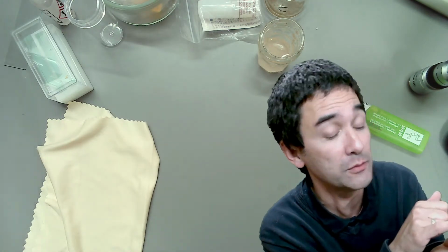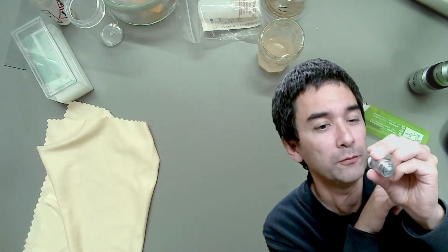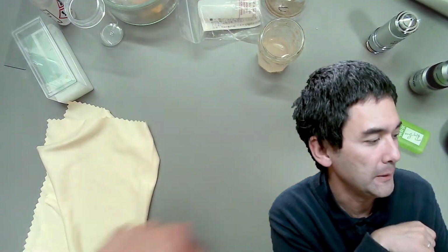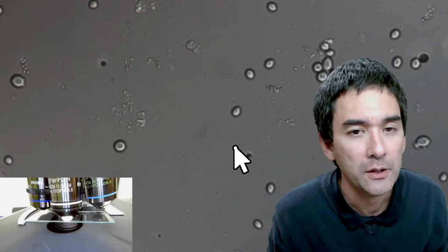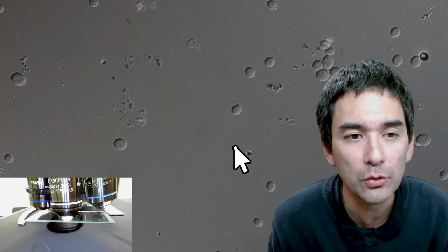You cannot see it sometimes from the front. Difficult, but usually you can see it quite well from the back. You can try it out. It actually works quite well. Okay, what time is it now? It's already 1 hour. So this was simply a short intro into oil immersion.